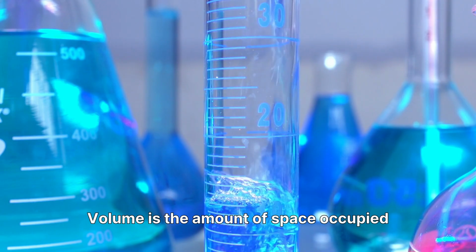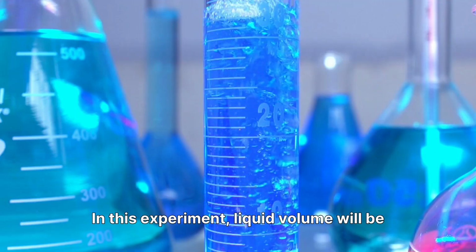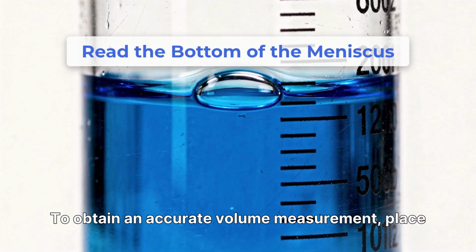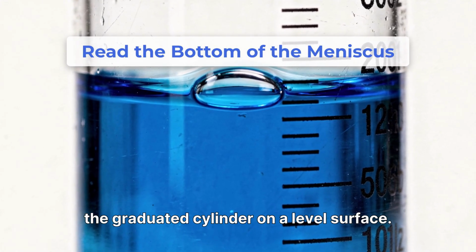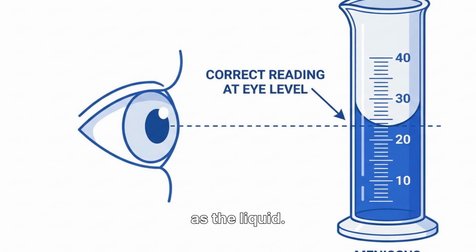Volume is the amount of space occupied by a substance. In this experiment, liquid volume will be measured using a graduated cylinder. To obtain an accurate volume measurement, place the graduated cylinder on a level surface. Bring your eyes to the same level as the liquid.